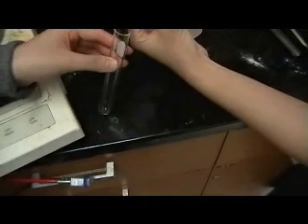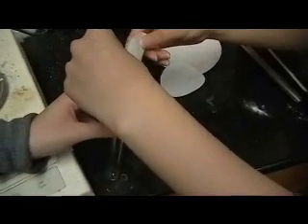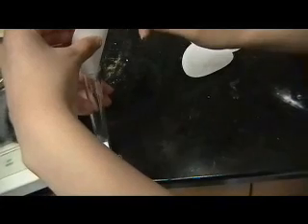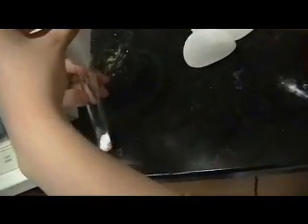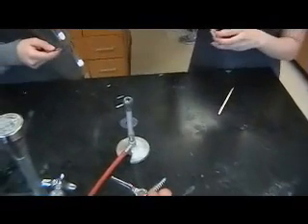Adding the two masses will give you the total mass of both of them before the decomposition occurs, which is important to show that the reaction occurred afterwards. After pouring all of the baking soda into the test tube, using a test tube clamp, light a Bunsen burner and heat the baking soda.